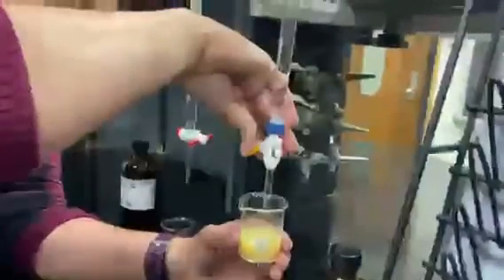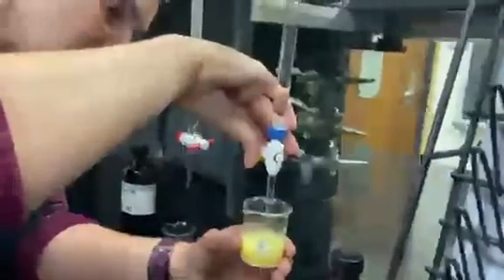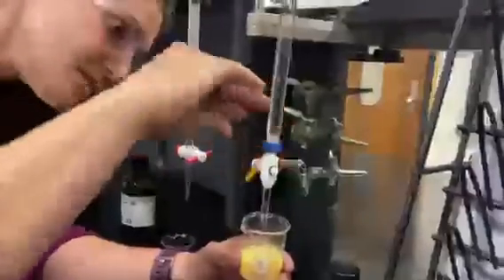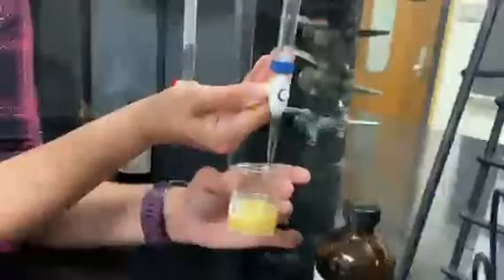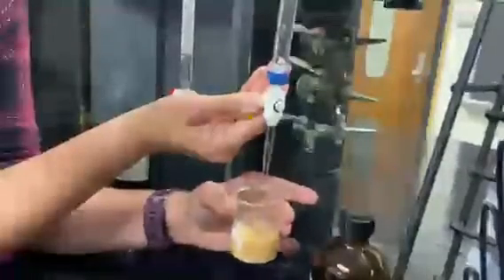Again, that's an error in my experiment. Errors happen to everybody. That's why we do multiple trials. If you see an erroneous data point that doesn't make sense, you always can throw it out. Those happen. User error, I'll call that one. Okay, I'm starting to see that reddish. I'm just going to go a couple more drops because it seemed to go away after a couple swirls. It's hard to add just a couple drops, isn't it? Okay, and yeah, that looks like it.